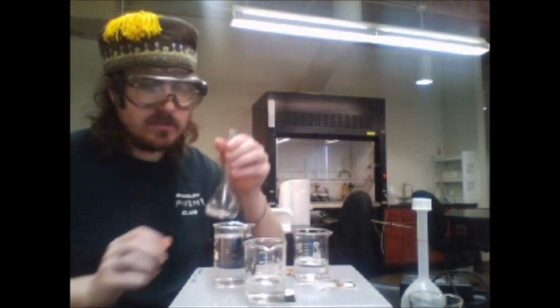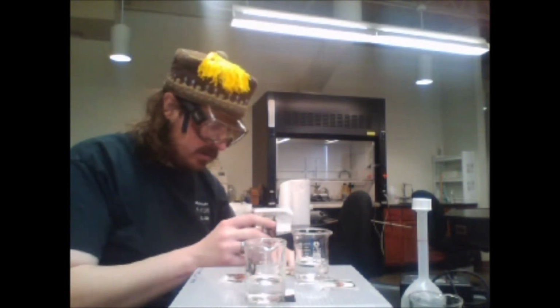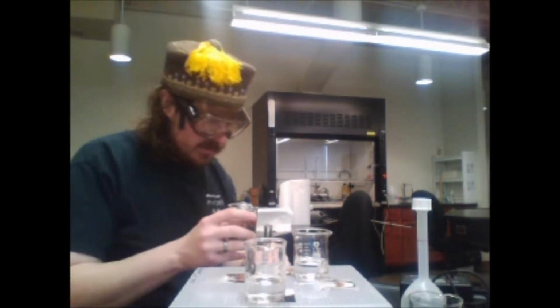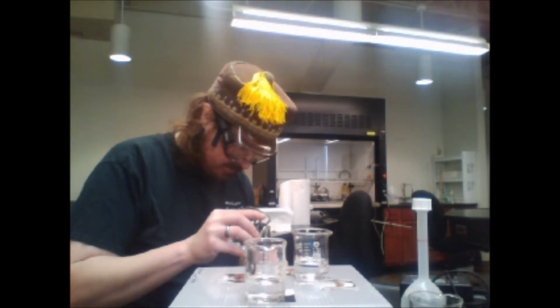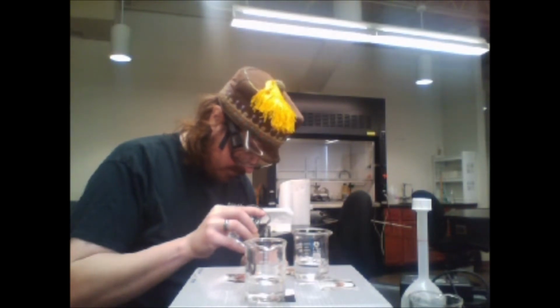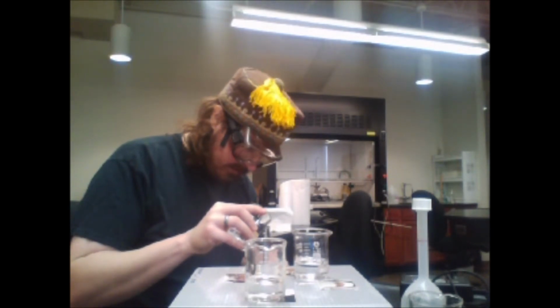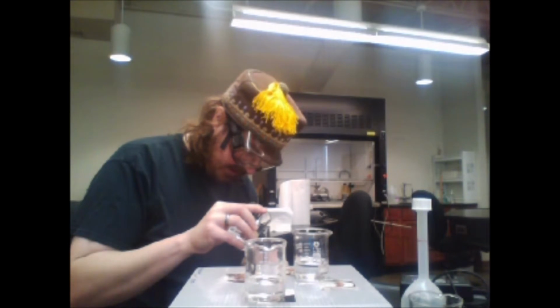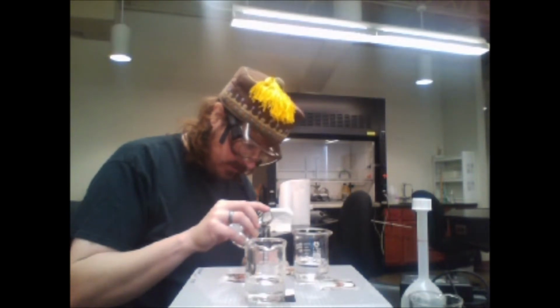Now I have to dilute this with our nitric. Here's where it might be a little tricky. I don't want to spill on the book. I'm not diluting with water, we're diluting with nitric acid. Not super concentrated, but if you were to get this on your skin, you would wash it off.